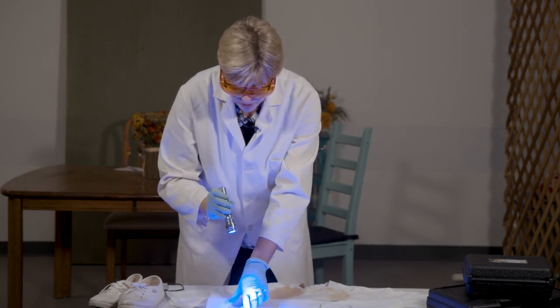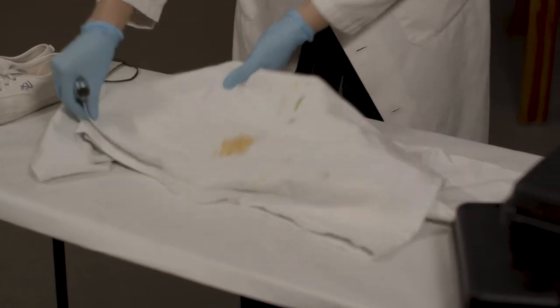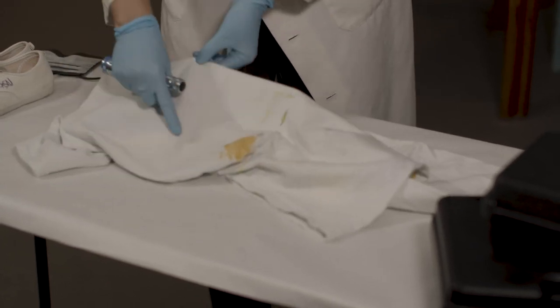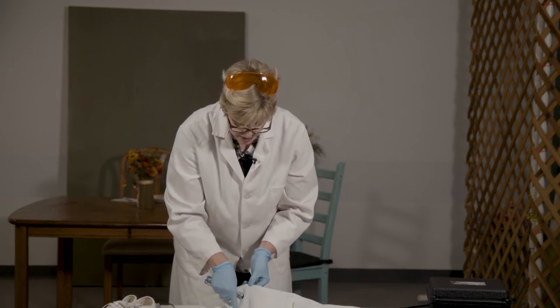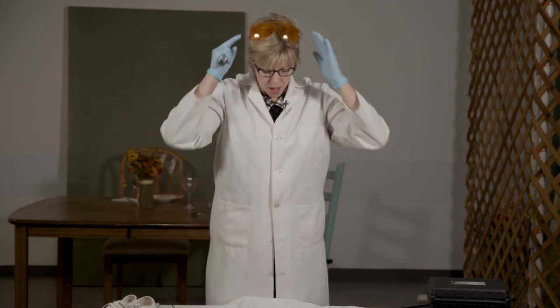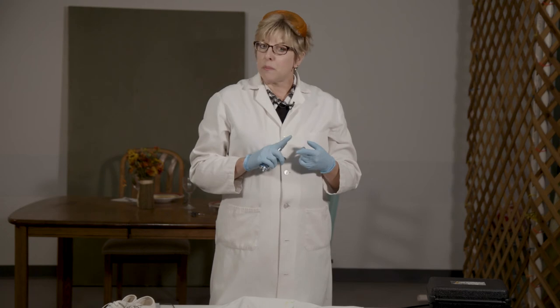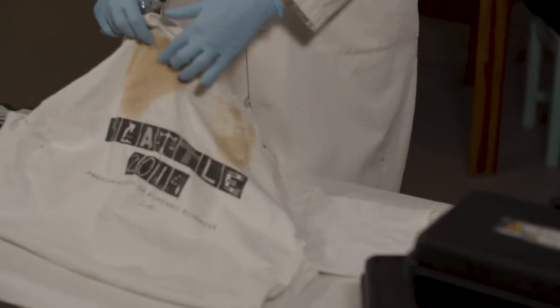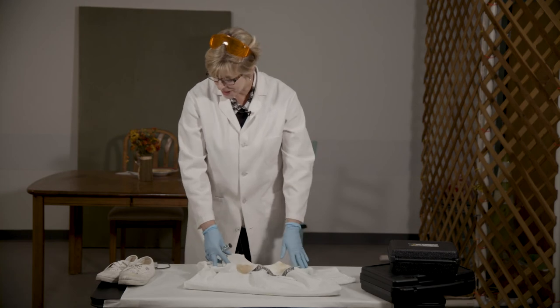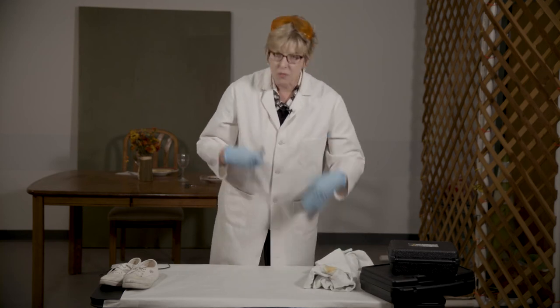We can also see some other stains here that fluoresce, but taking the light off, they are not that visible — they're almost whiter than the actual substrate themselves. This here is an example of bleach. So there are a lot of things that can fluoresce even under the alternate light source: bleach and cleaning supplies can fluoresce, as can various inks, chicken wing sauce, in addition to biological fluids. So it can be important for you as the analyst to be aware of that.